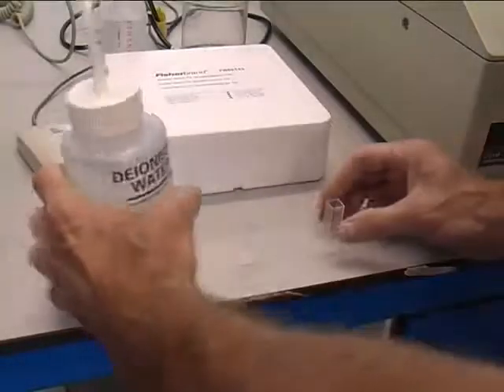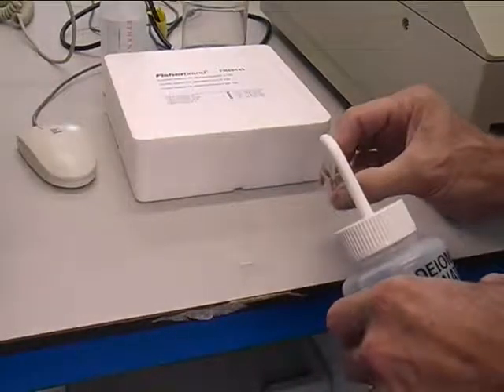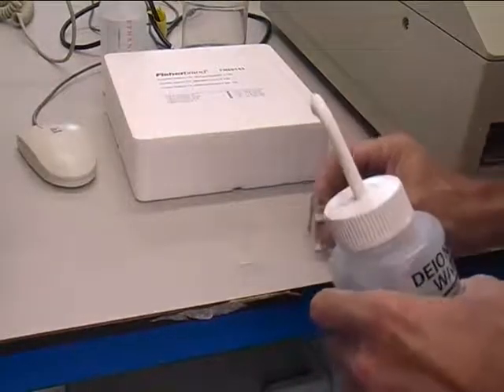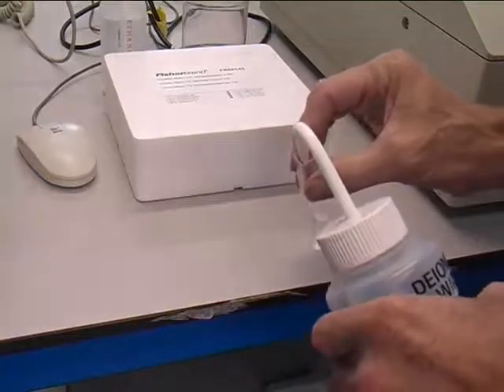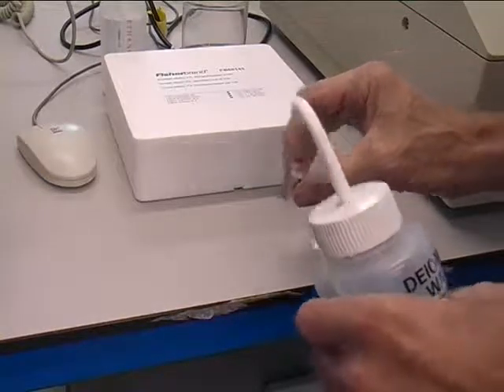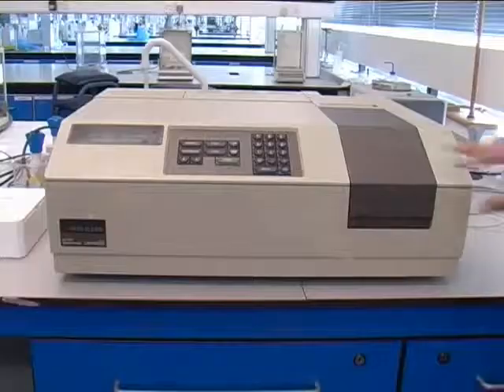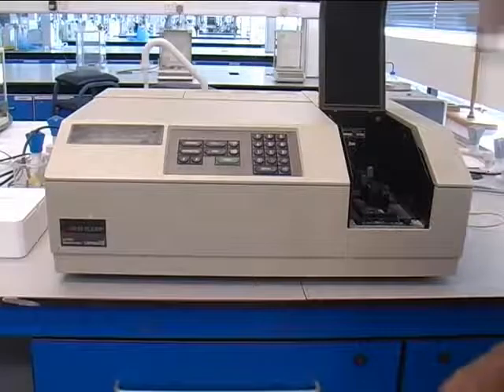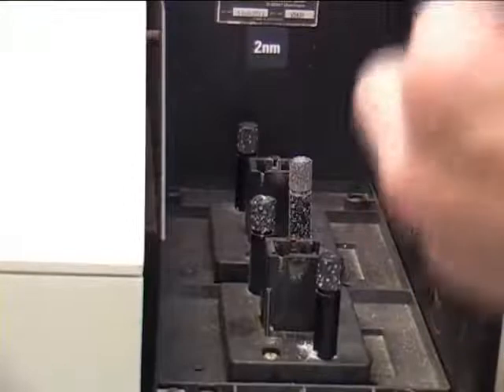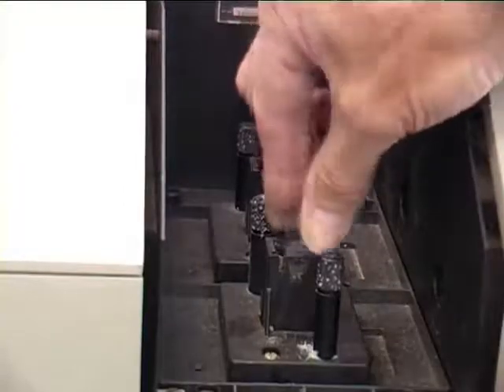First, fill two cuvettes with deionised water. This will be used for a reference. It is important to only touch two sides of the cuvette, as the other two sides must be clear for the beam to pass through. Some cuvettes will have dimples on — that will be the side you handle.